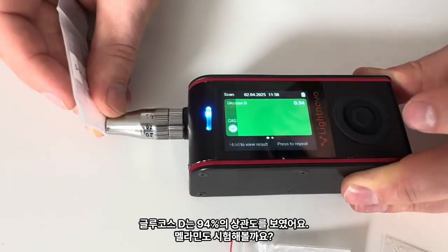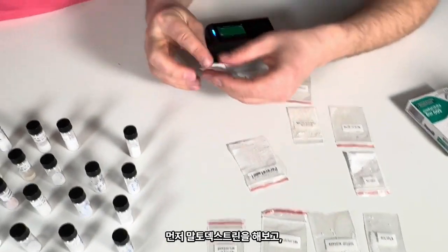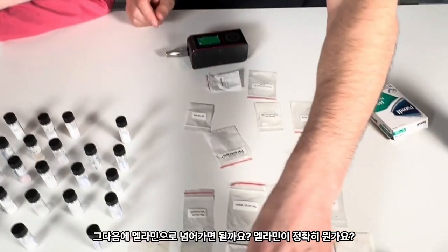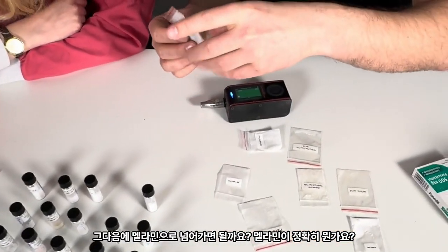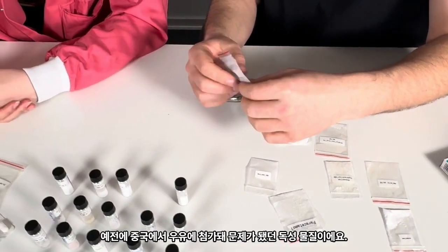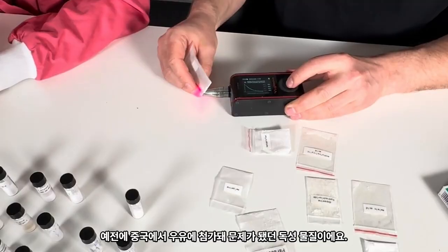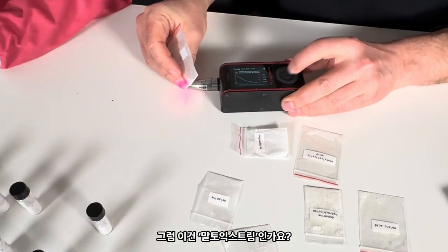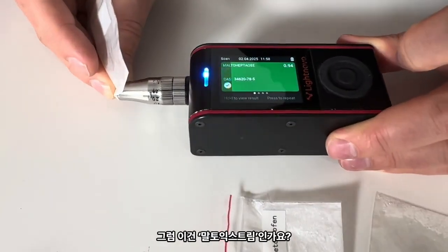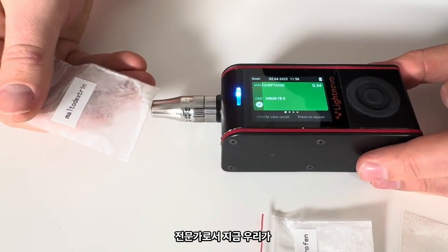Glucose D, 94% correlation. Should we try melamine? Can we try maltodextrin first and then melamine? Okay. What is melamine? Melamine was a case in China, I think. Yeah, it's a toxic compound they added into milk in China some time ago. So what's this? Maltodextrin, and it's maltodextrin.